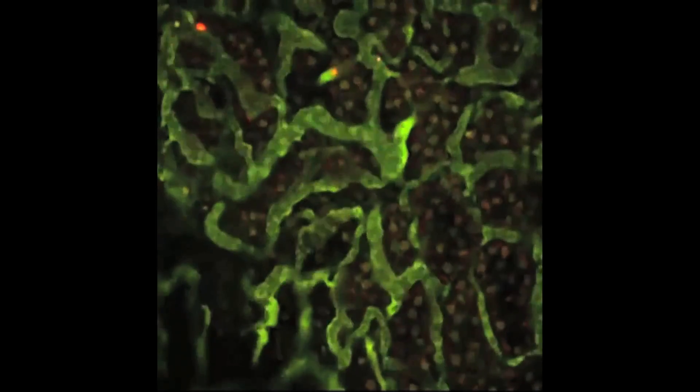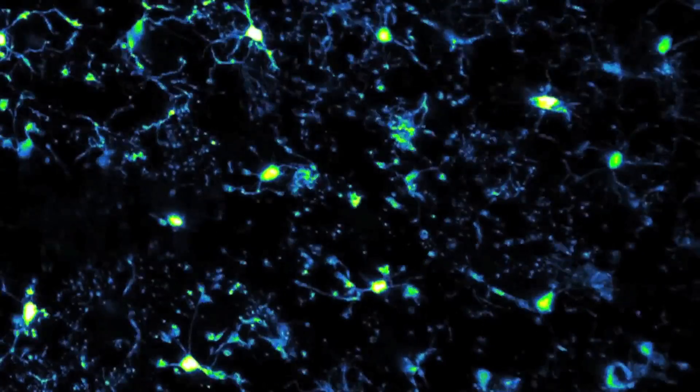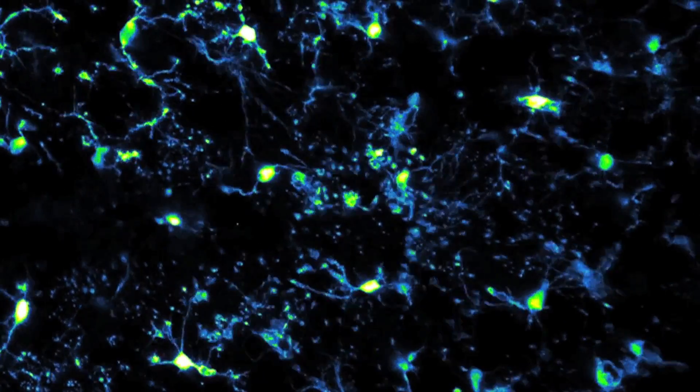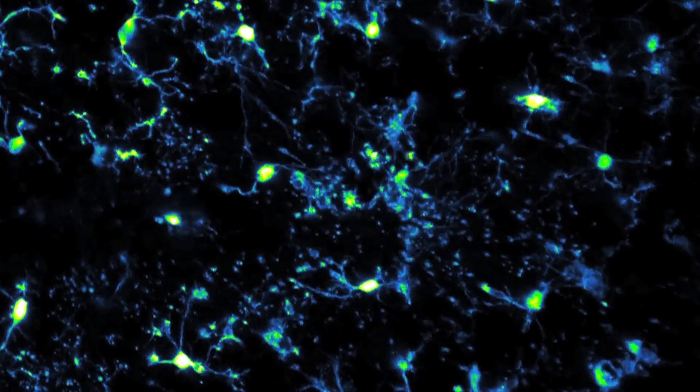The way that we can look at individual neurons in the living brain is that we can inject them with a protein that fluoresces, which we can excite at specific wavelengths with the two-photon. And that way, even though there are millions and millions of neurons in your brain and if you were trying to look at all of them at once with all their connections, it would just be a big mess.